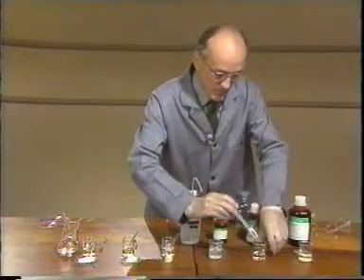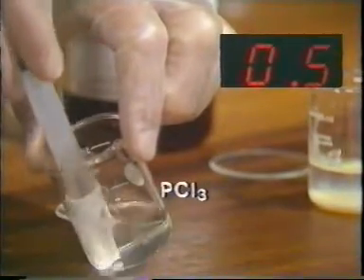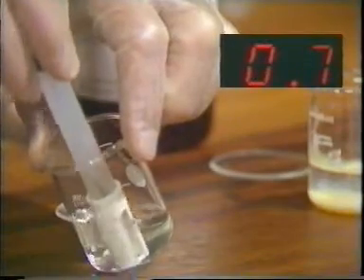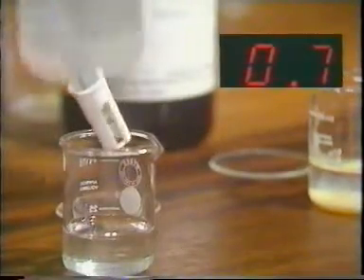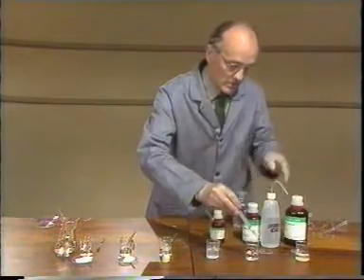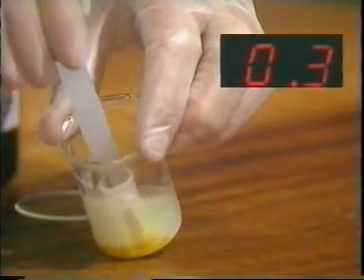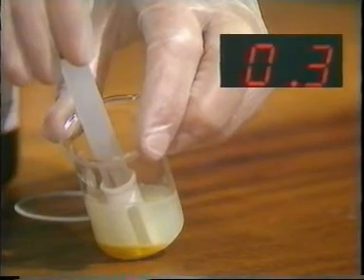Next, the phosphorus trichloride solution. And here we have the pH 0.6, 0.7. Rinse the probe again before doing the last one, the sulfur chloride. And here we have 0.3.